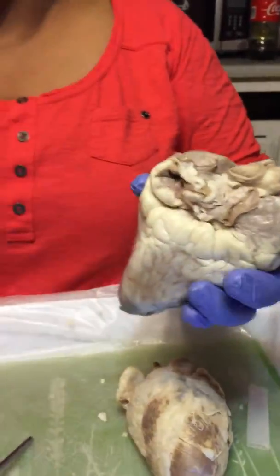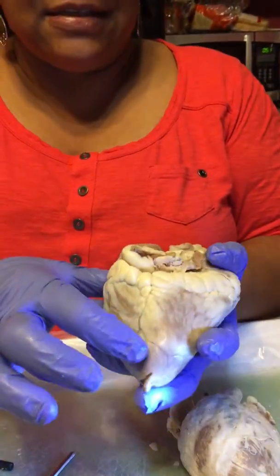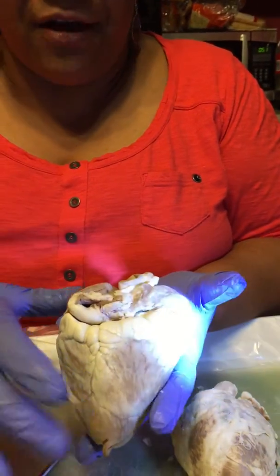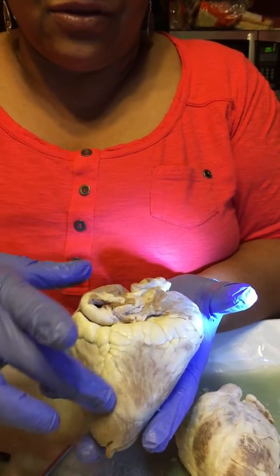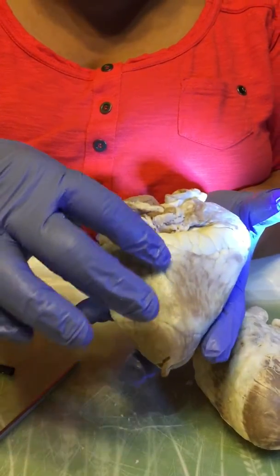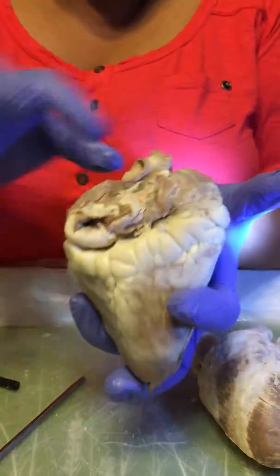Okay. The coronary sinus is usually kind of right in here, and this is deoxygenated blood coming off from the coronary arteries and then going into the veins after it has oxygenated the myocardium, going into the veins and through the coronary sinus, and it's going to empty into the right atrium over here.